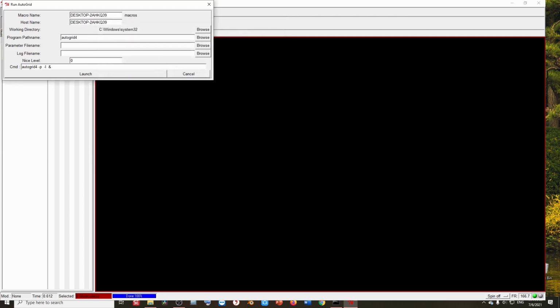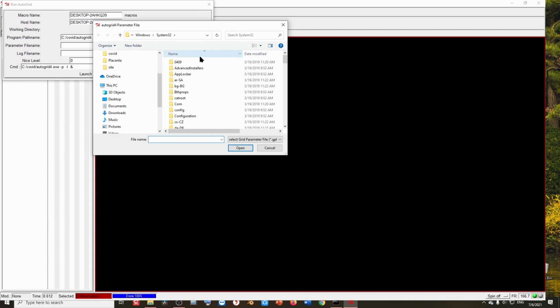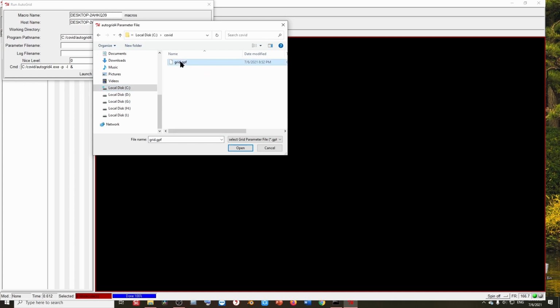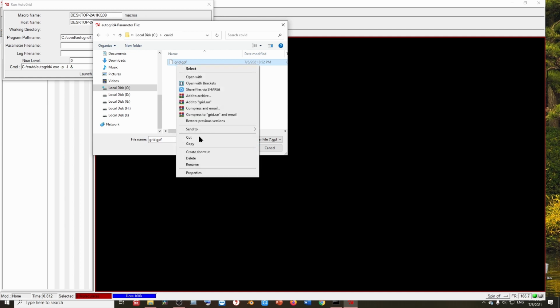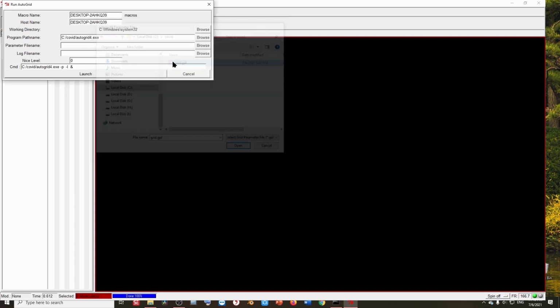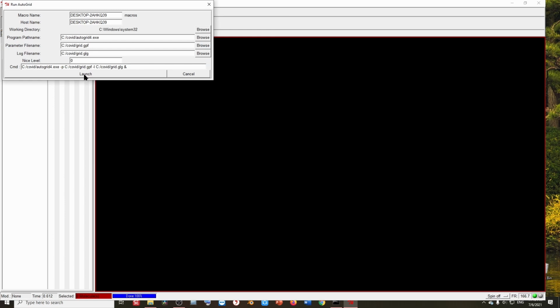Because we are going to run the AutoGrid first, let's select AutoGrid. Secondly, I have already created the parameter file. If you do not know what I am talking about, please first watch a beginner tutorial on YouTube about docking. Here I have already created this parameter file, and it looks something like grid.gpf. Again it's very important that the name should not contain any space. If the name was like this, again it would cause a problem. It will render an error. So there should be no space. I don't know why this program hates spaces, but that is what it is. So let's open it, and now it should not cause any problem.